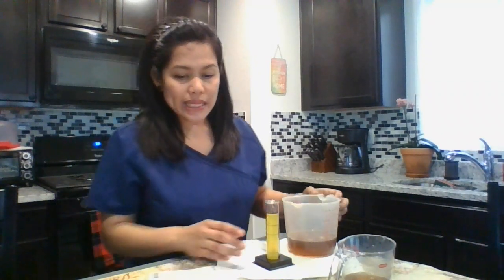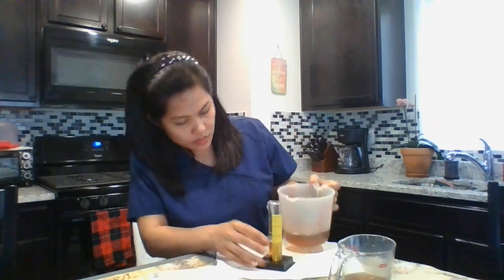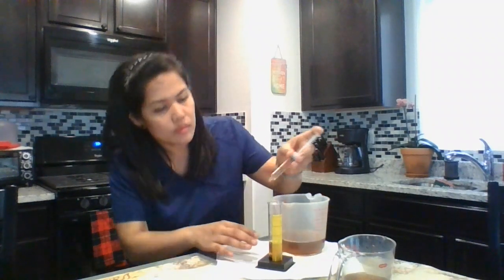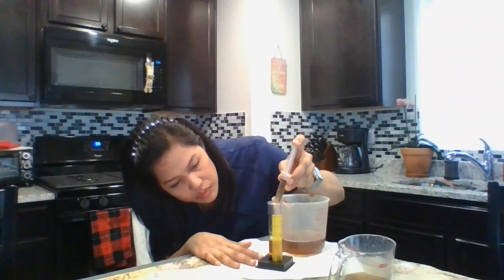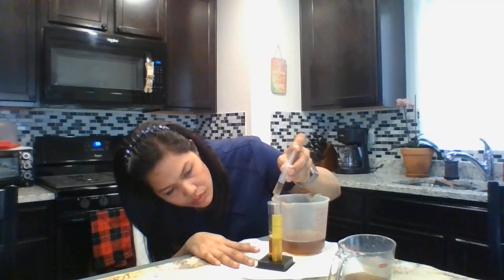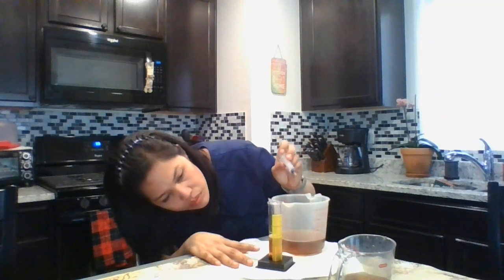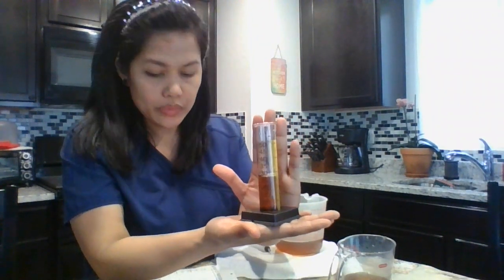The last one is 28 milliliters, so I have 28 milliliters times 5 equals 140. I'm going to measure 28 milliliters. This is 28 milliliters.